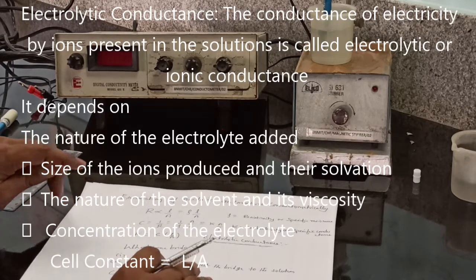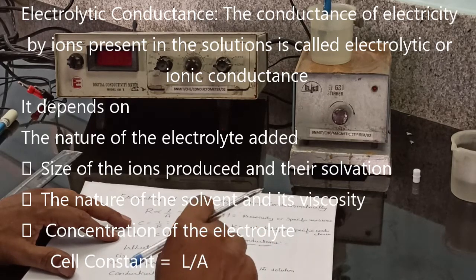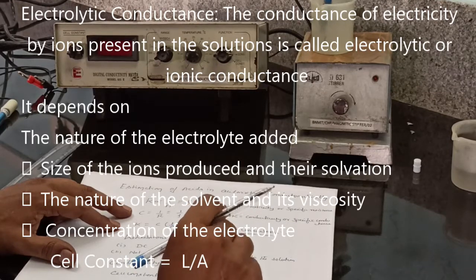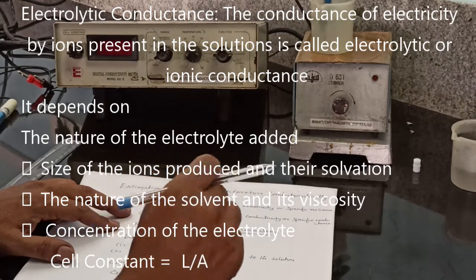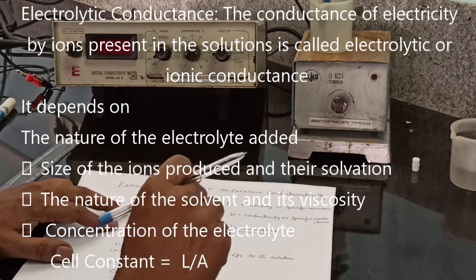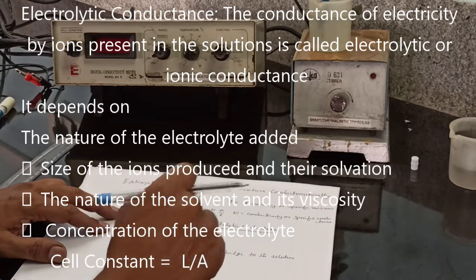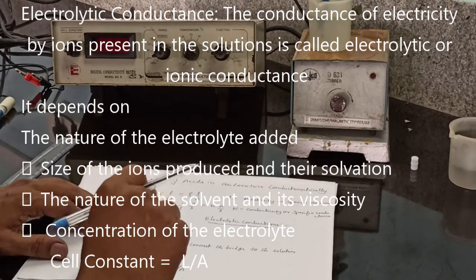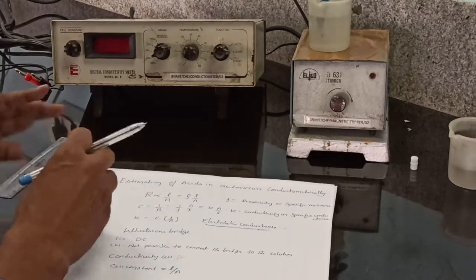How to measure the electrolytic conductance? If you measure the resistance, we can convert it into conductance because the inverse of resistance is conductance. Resistance is normally measured with the help of a Wheatstone bridge, but we face two problems for an ionic solution. The first problem is passing direct current, which changes the composition of the solution. The second problem is that it is not possible to connect the solution directly to the bridge. The first problem is resolved by using alternating current. The second problem is solved by using a specially designed cell called a conductivity cell.